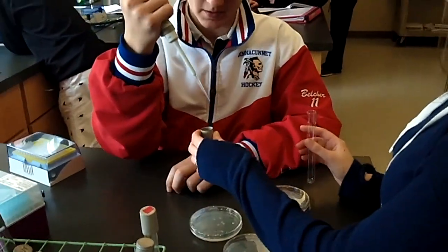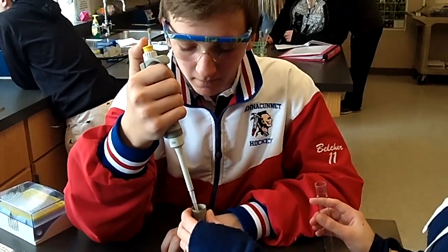After a few days, you'll notice that your tube looks different, and when you dilute your culture and spread a droplet on an agar plate, the colonies may look different.